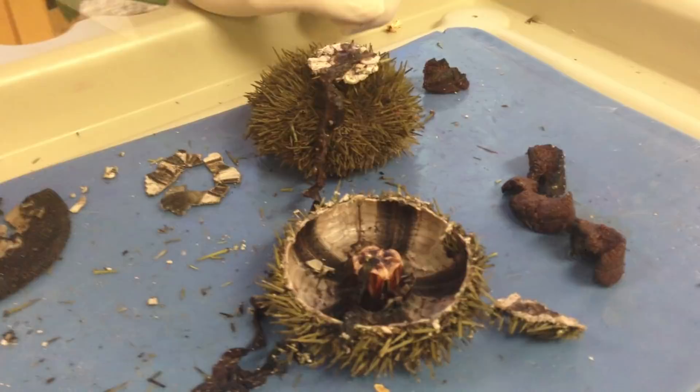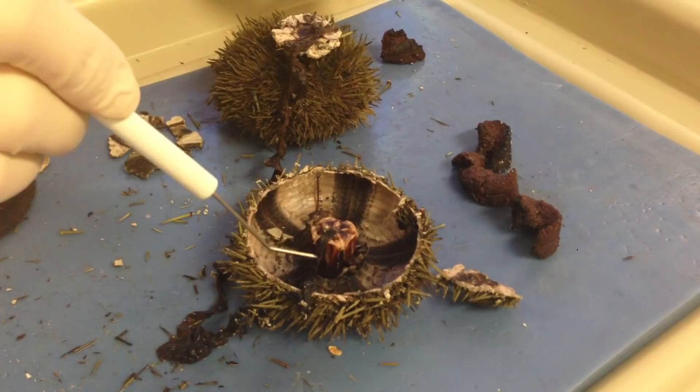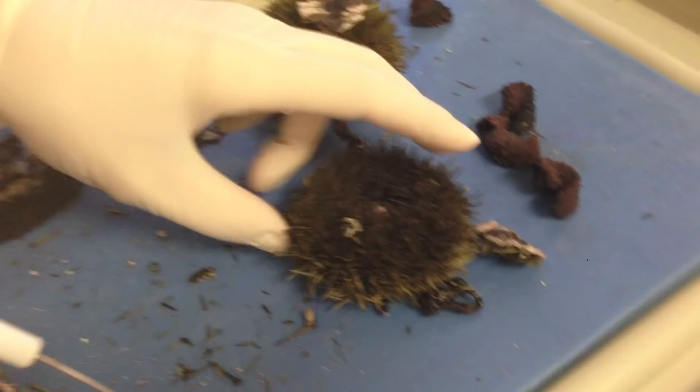Working backwards, what we have here is the anus to the intestinal tract, which goes into the stomach, which leads to the esophagus, which leads to the pharynx, which is in the middle of this white structure. The white structure is actually Aristotle's lantern, which when you flip it over leads to this little white structure, which is the teeth, and this is the peristome.